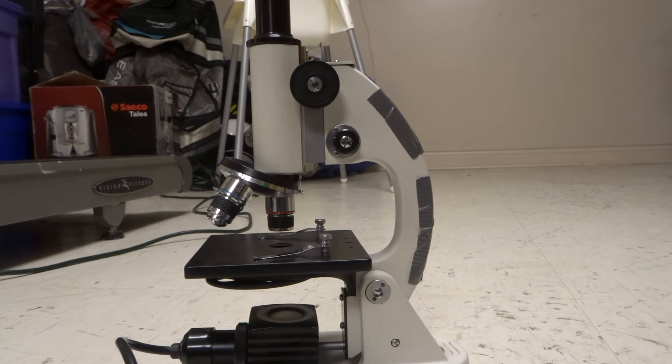So that's just a rule of thumb, but that is how to adjust and how to focus a microscope with some super easy instructions. And you're going to get the best focus on whatever you're looking at and studying.